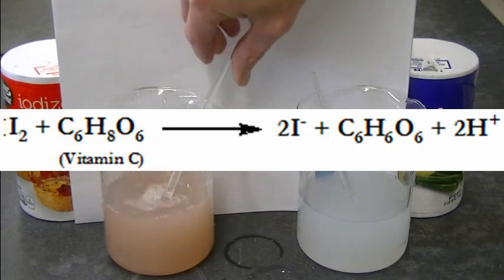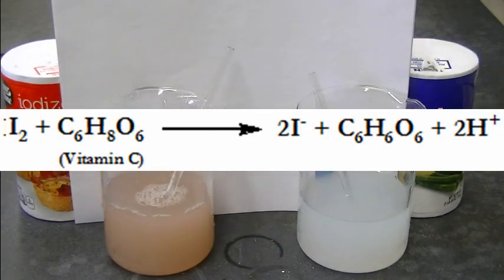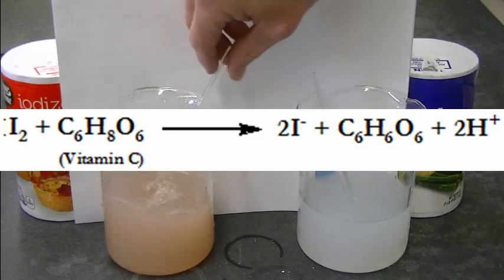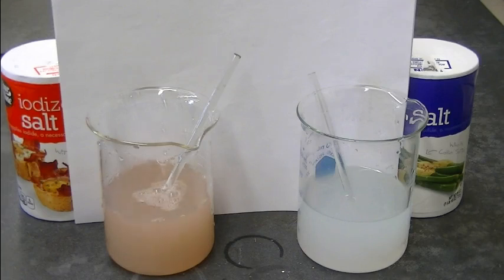You can see that blue-black color has faded to what looks like an amber or brown. This has been a demonstration of Journal of Chemical Education's Classroom Activity number 92. Happy experimenting!